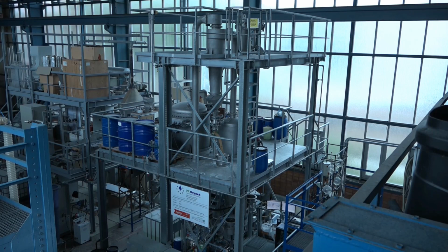So this is our experimental hall, and here we have a really big fluidized bed equipment with a lot of peripheral apparatus. So I just want to explain first what kind of apparatus these are. The process chamber itself is located here, and above this we have an expansion zone.